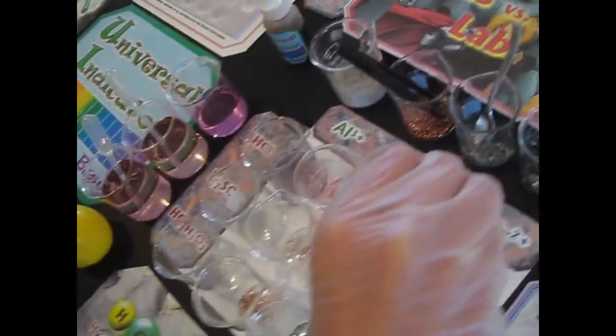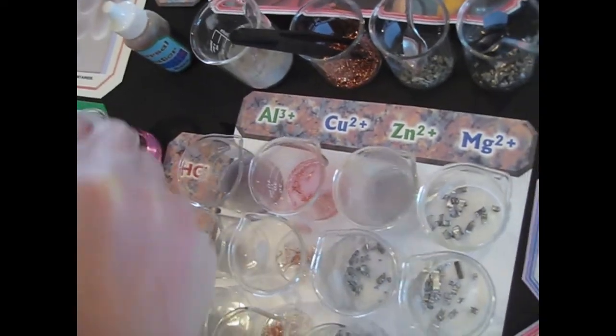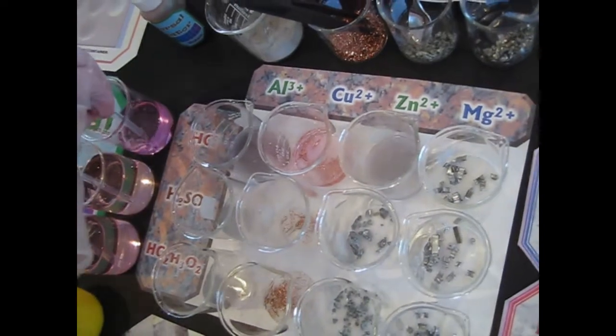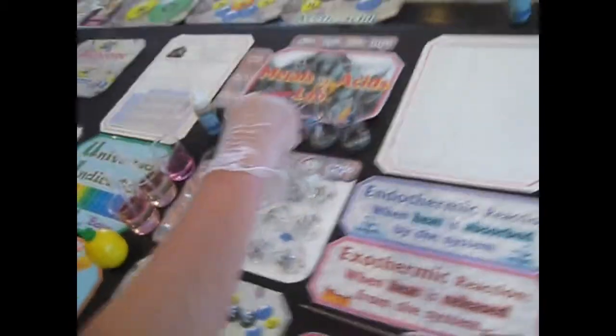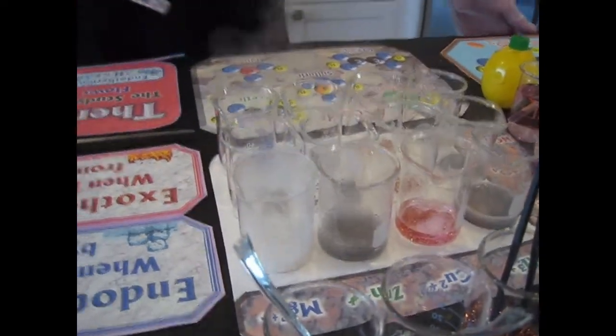So which one was the more dramatic of this particular row? Which metal? The zinc. Okay. Now keep in mind in chemistry, not everything starts immediately, so don't assume because something did not start immediately that it won't react. Maybe not all of these will react, but we can see some really good reaction. How would you describe what's going on here?